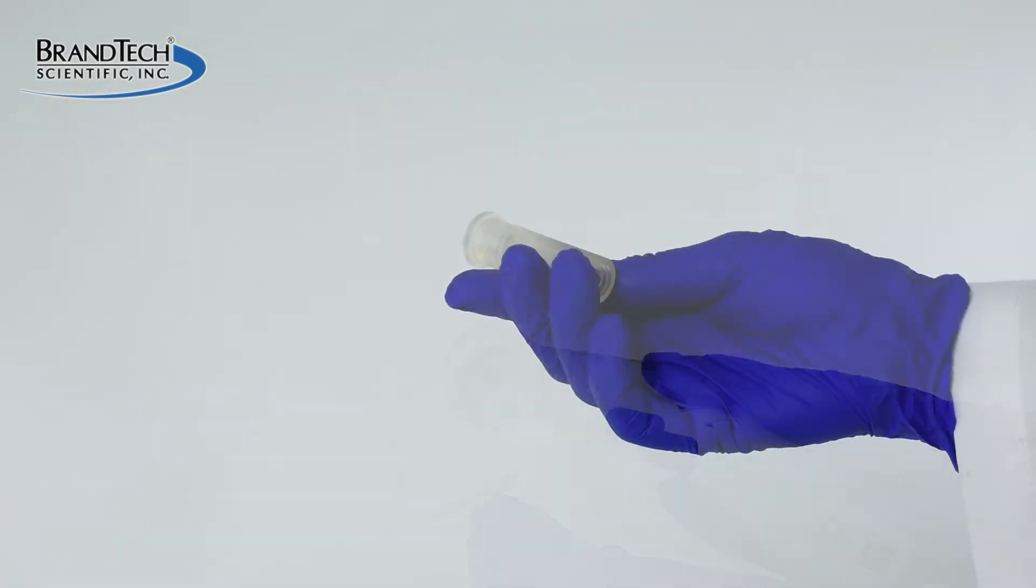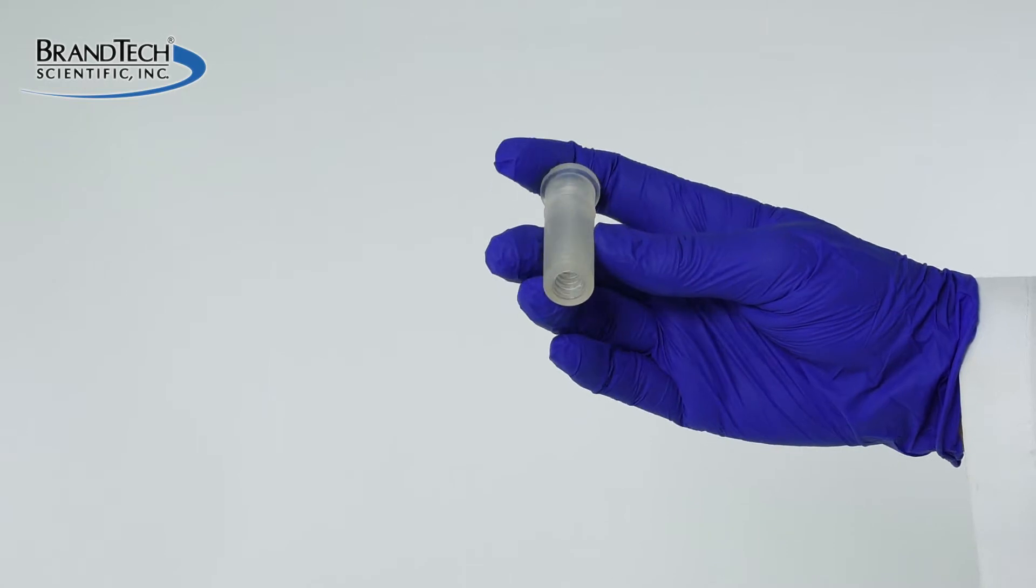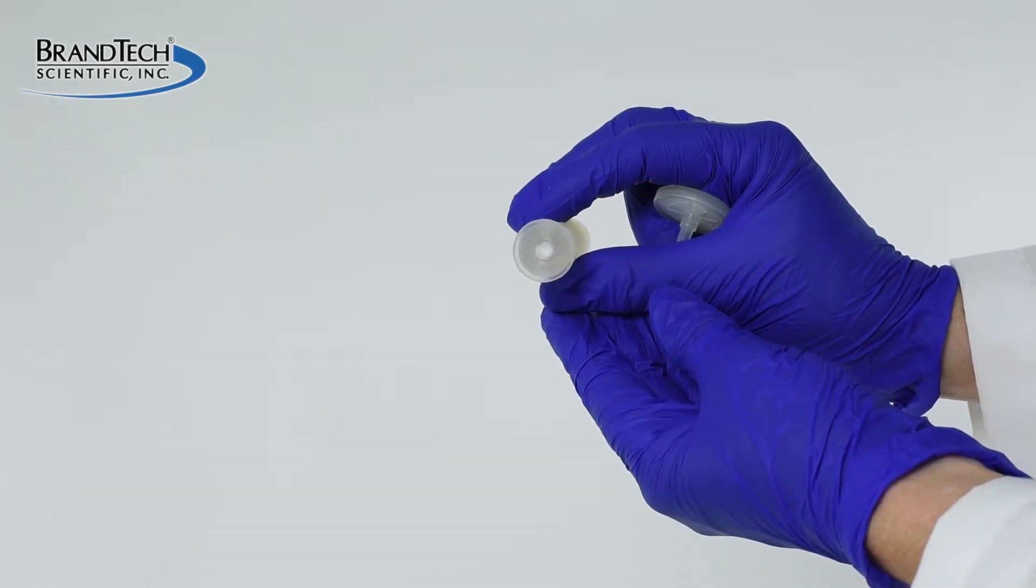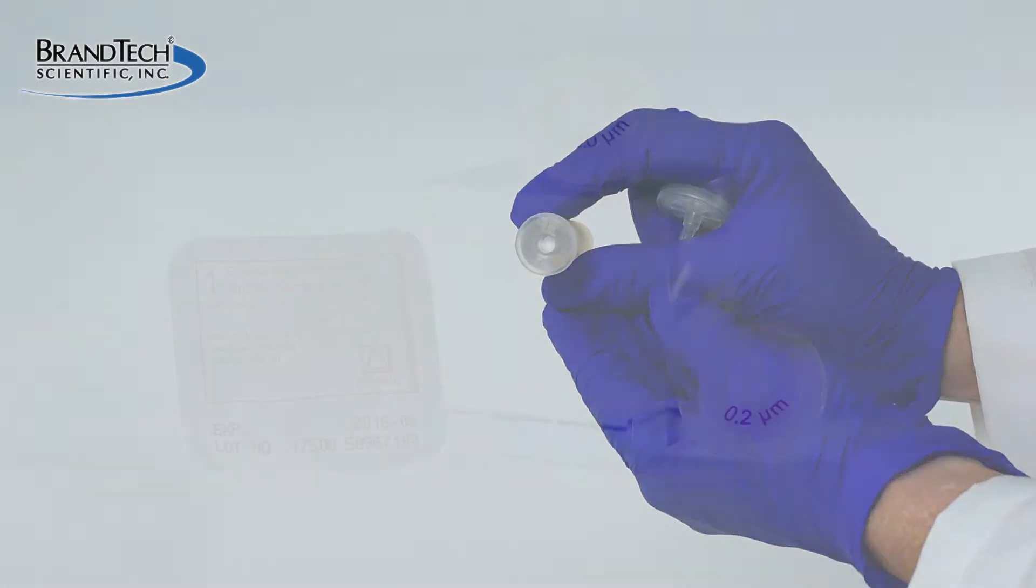Use this opportunity to inspect the silicone adapter for cleanliness and damage, and be sure the check valve is intact. Clean or replace if necessary.